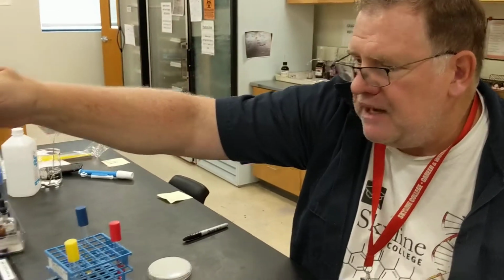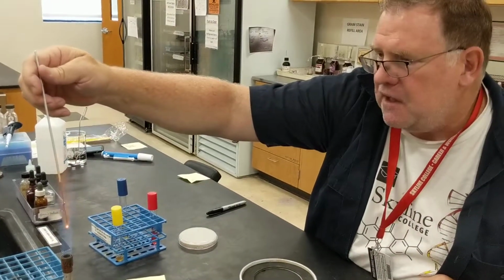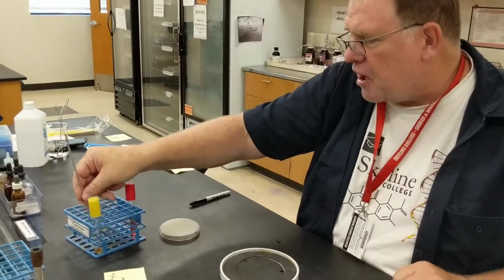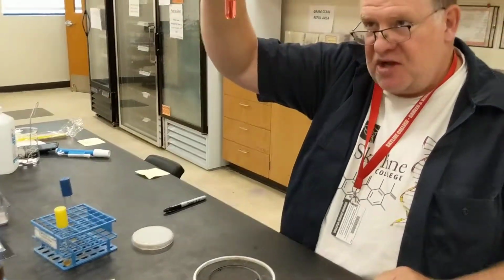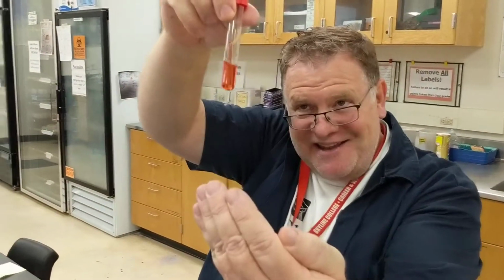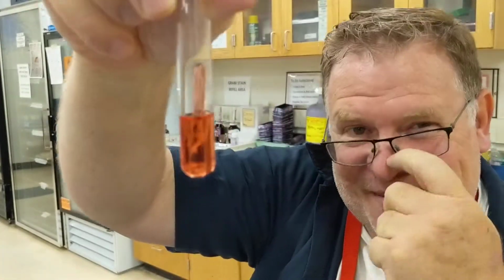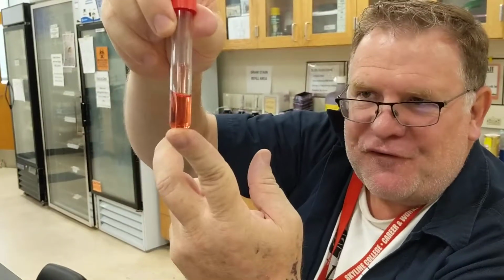The next media that we're going to be looking at is a carbohydrate media. This carbohydrate media has in it a substance called phenol red. Can you see it? It's red? Yes. And is there something inside of there? Yes, there is. Do you remember what that is? I told you what it is. Durham? Ah, it's a Durham tube. Oh, you remembered. Okay, and so this is the format that we have.